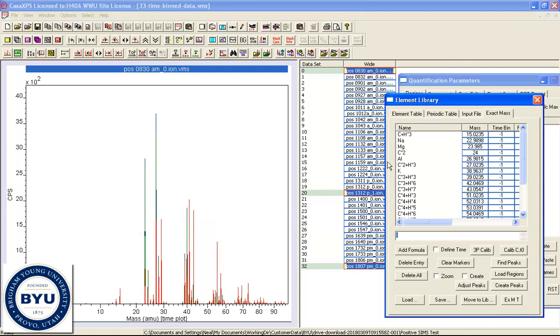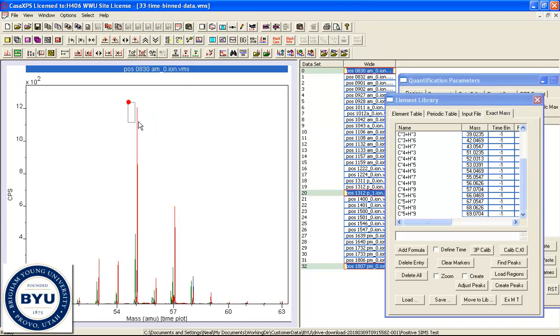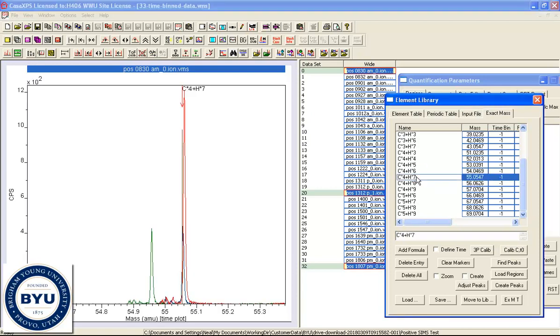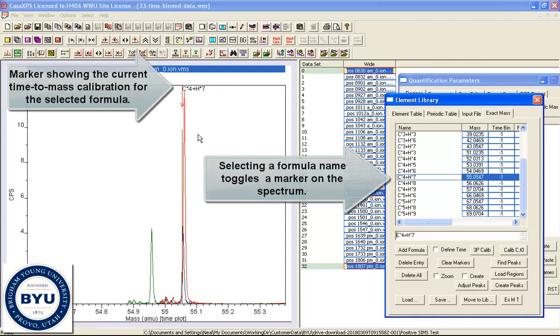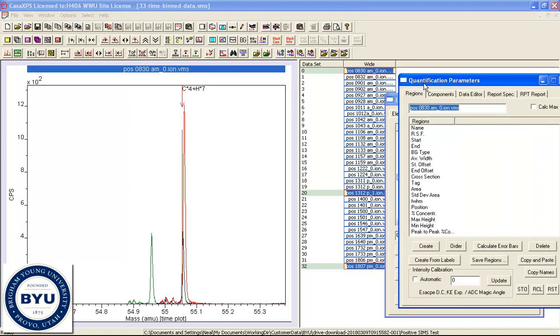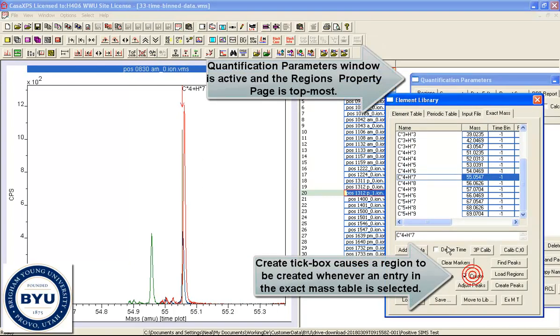So the first one we'll do is we'll pick a relatively high mass peak, and we're looking at 55. So there's a peak that could be used to calibrate, assuming that this is the C4H7. So let's choose this one, and what we're going to do is we've got the quantification parameters window up, and we can then say create when we select a line, and what this has done is created a region.